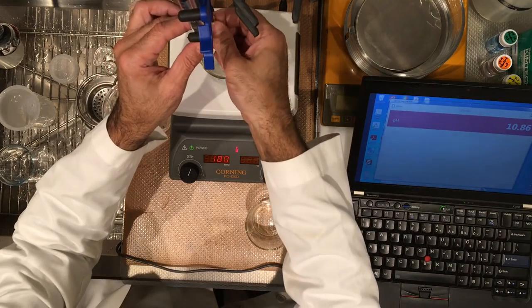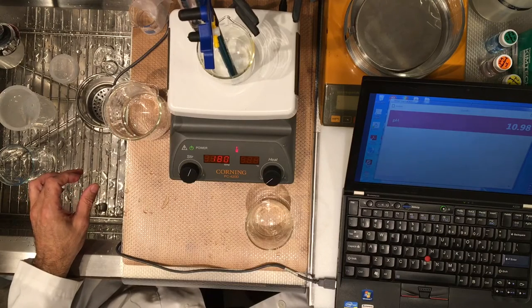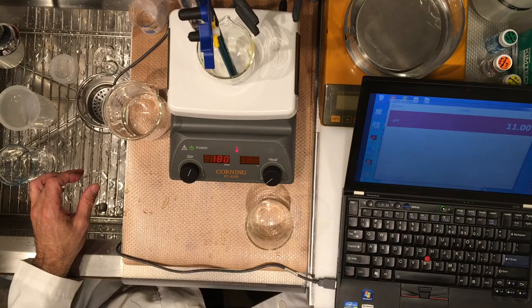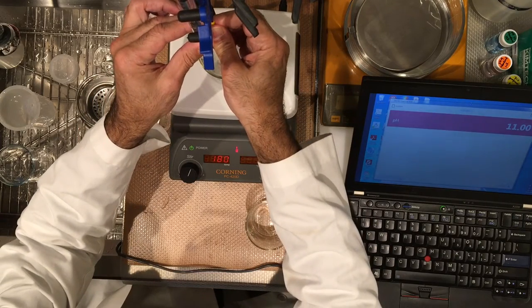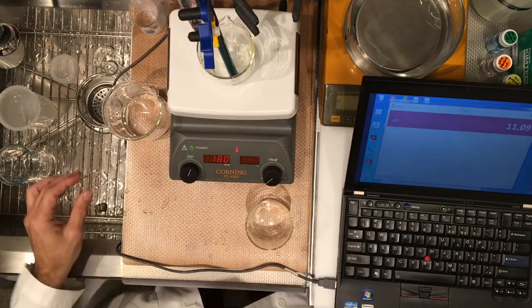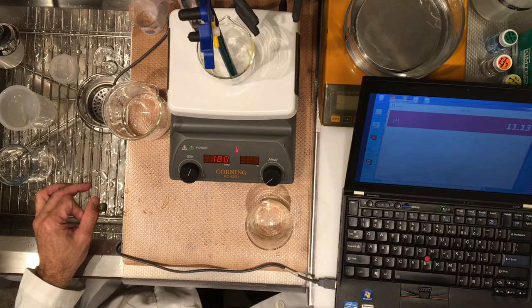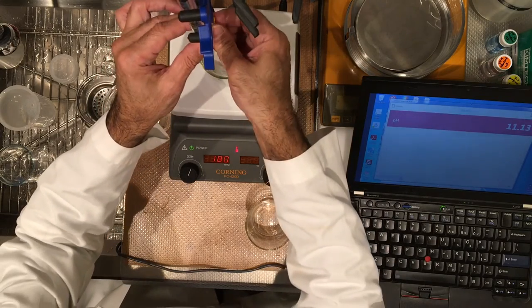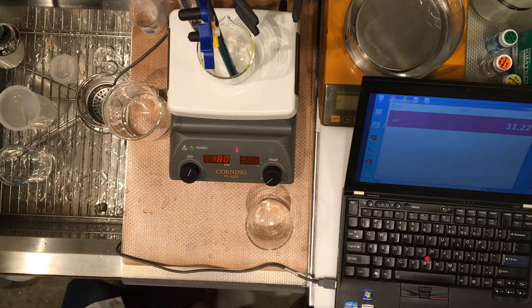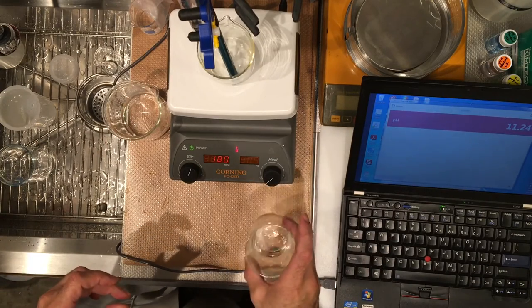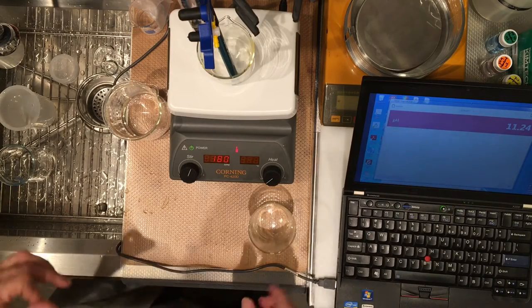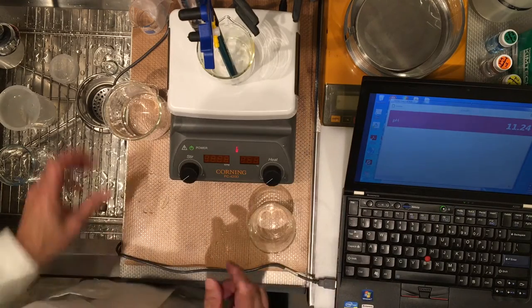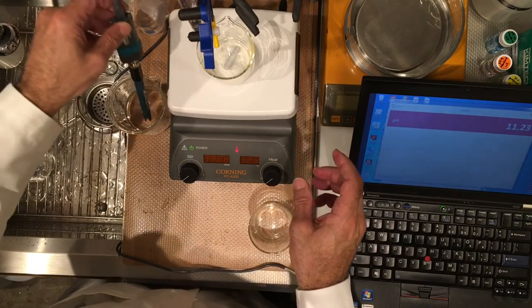Record let's go to 13. Record now we'll go to 13.5. Record and we'll stop at 14. This is our last measurement. Okay so done with the second run so now we only have one more run to do.